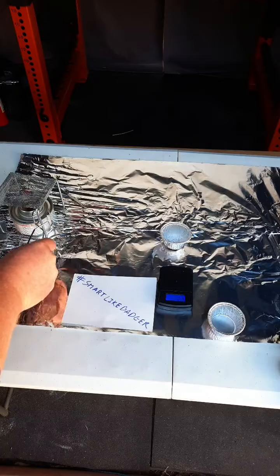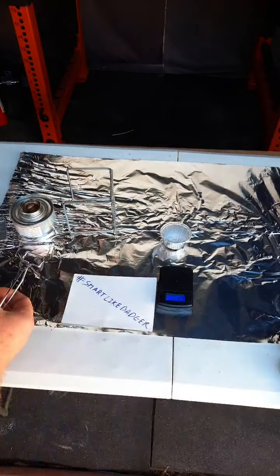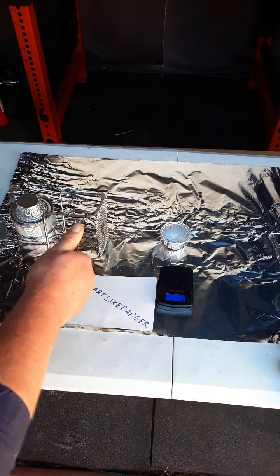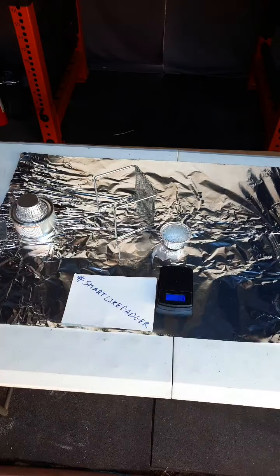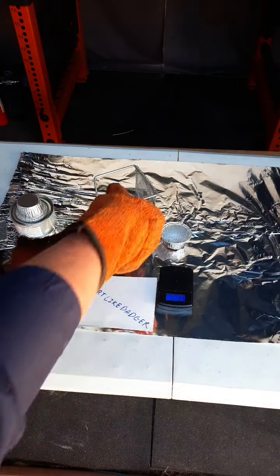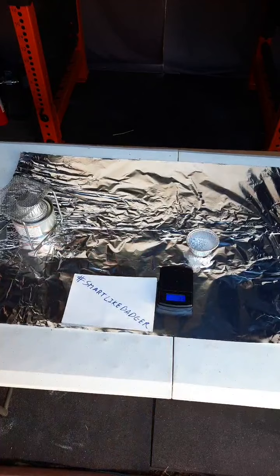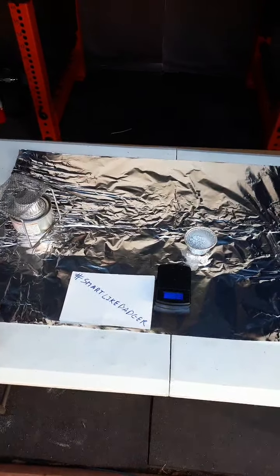Because we're done with the flame, we'll remove it and extinguish the flame. That is set up right there. This canister is still hot, and everything here is still hot. Boris wants to place these things all together before doing calculations and make sure things are turned off. There we go. We are done with the experiment. This may be disposed of. Follow the lab instructions for how to dispose of things.